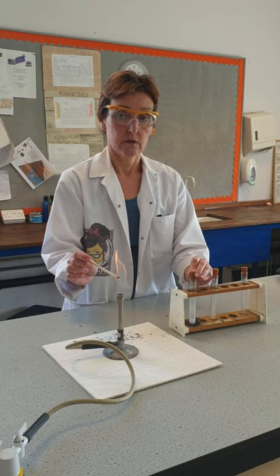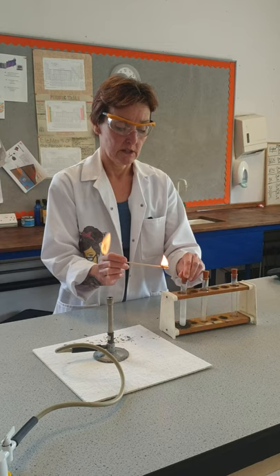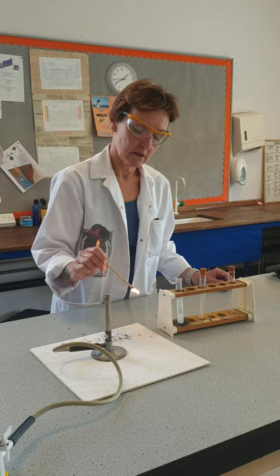I have made hydrogen by mixing two chemicals together. So again I'm lighting my splint, taking the top off the hydrogen, putting the splint in and you can hear — let me do it again — it burns with a wee pop. And that's the test for hydrogen gas.